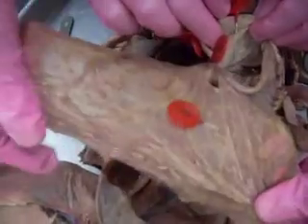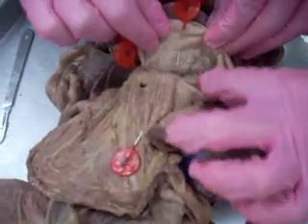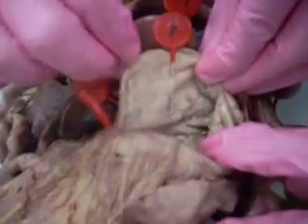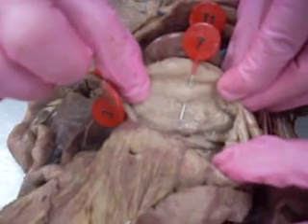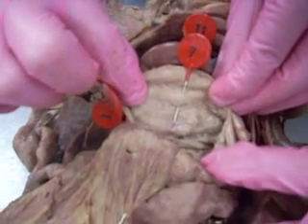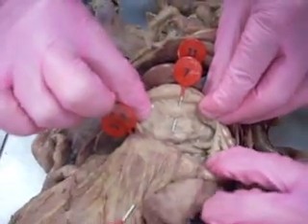Inside the stomach, as we cut it open, number 7 shows the rugae — the wrinkles in the stomach that help move things through.